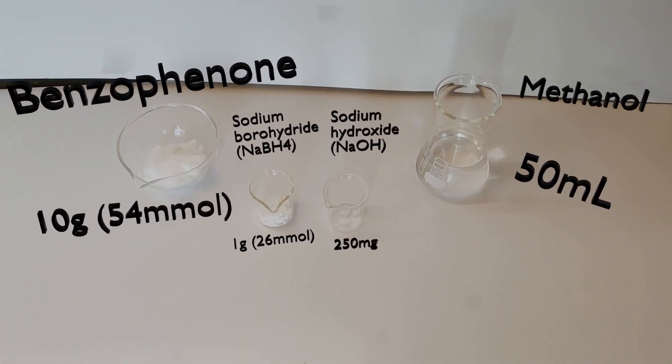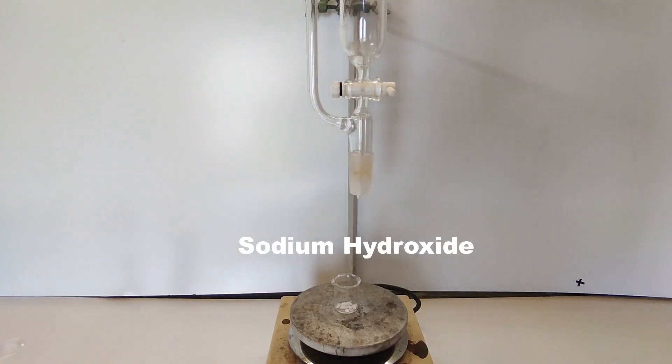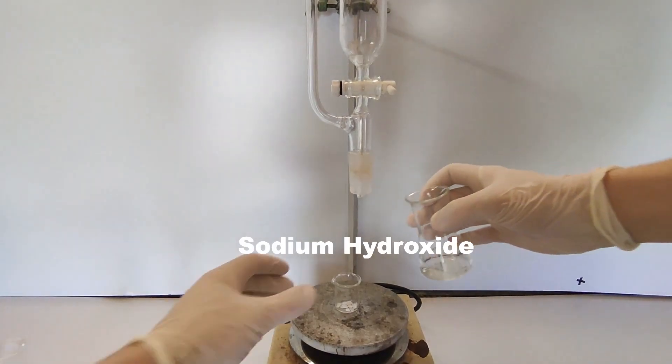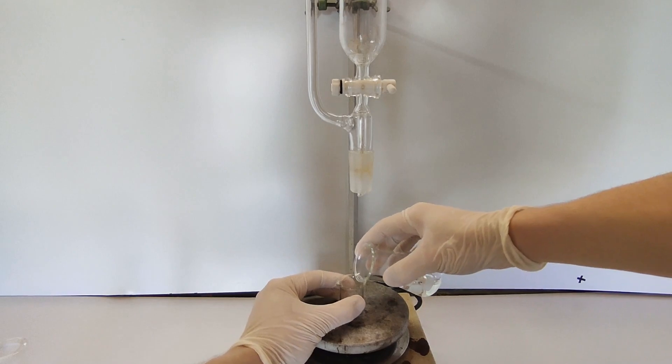Greetings fellow nerds. In today's video we're going to be synthesizing some benzhydrol.